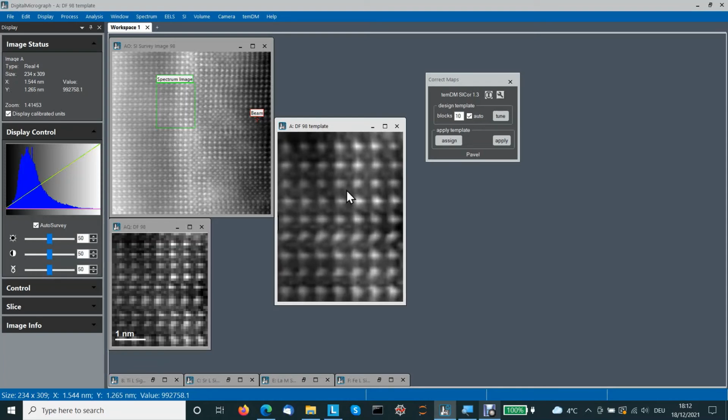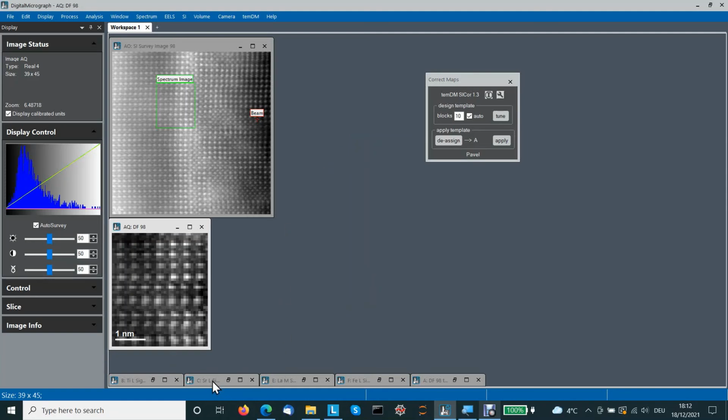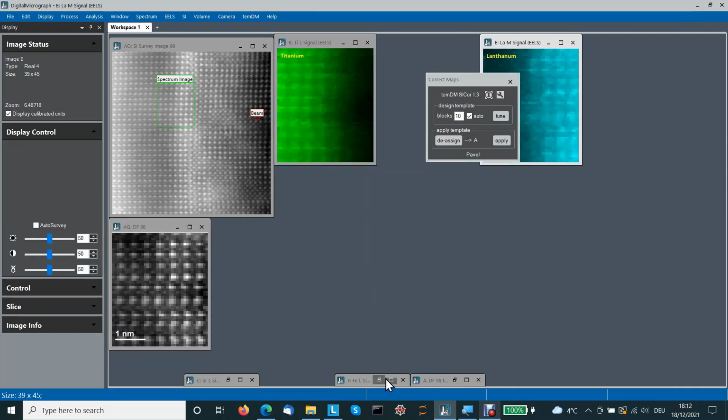Finally, we want to correct elemental maps. Note, however, that all deformations we have applied are now stored in this corrected dark field image. That's why it is called a template, because it contains all the information for correcting similar images. What we have to do further is just assign this template to our map. It is assigned. We don't need the template anymore. And let's open our elemental maps.